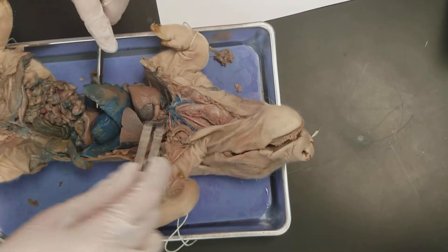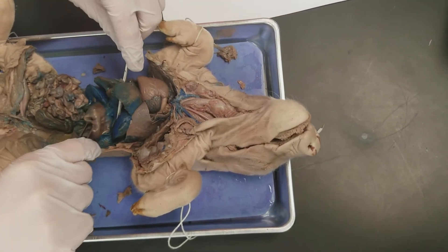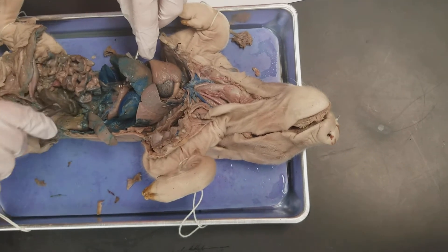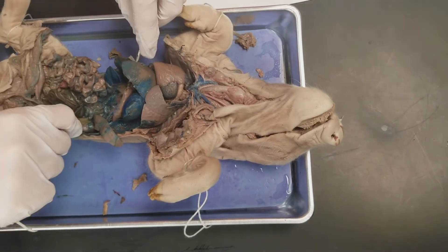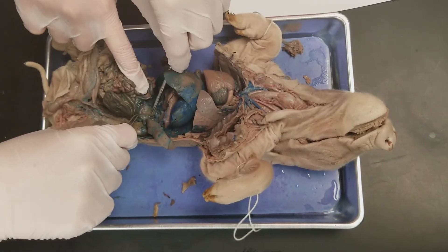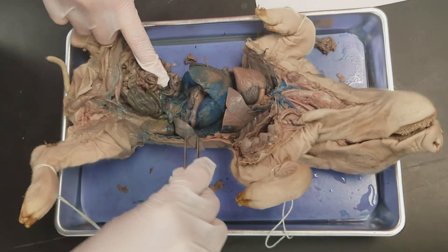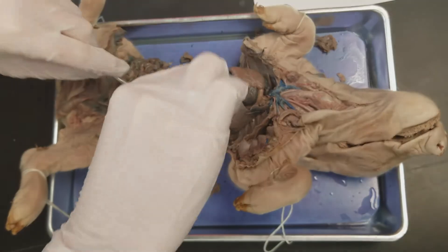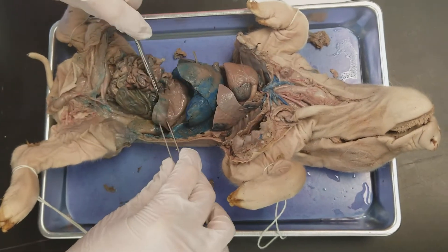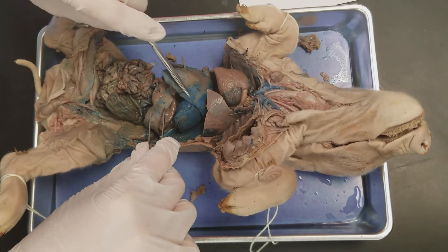The pancreas is underneath the stomach back here — it's this spongy kind of structure down here. The spleen is this right here; it's the kind of tongue-looking thing that wraps on top of the stomach.